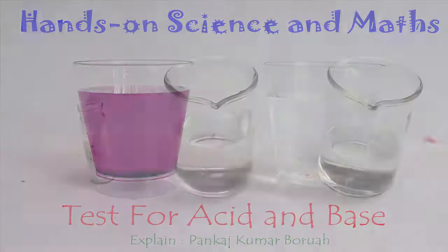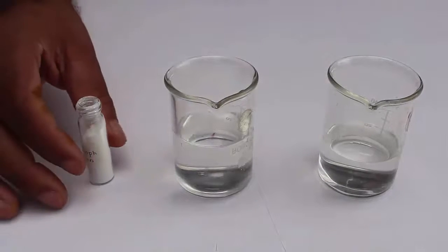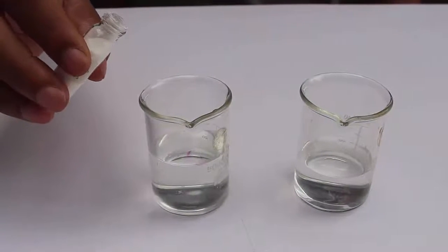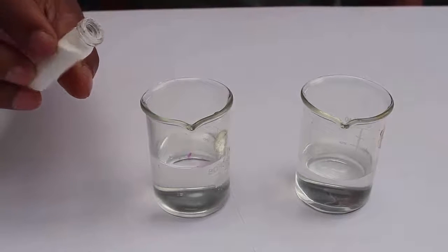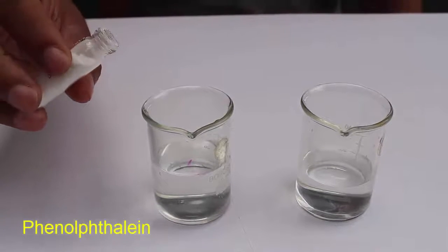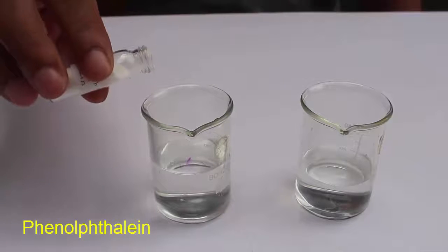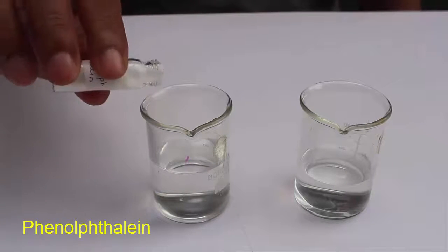We will test them by adding a bit of phenolphthalein, which is an indicator, to both the solutions. First, I add phenolphthalein powder to the first beaker.